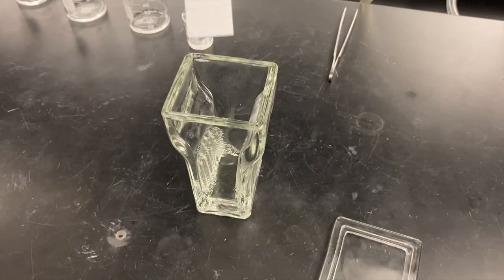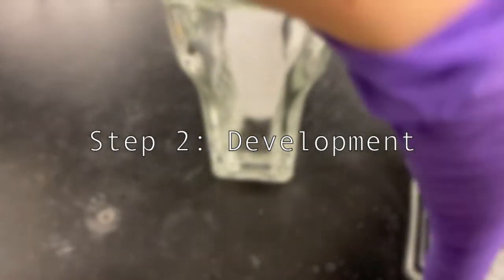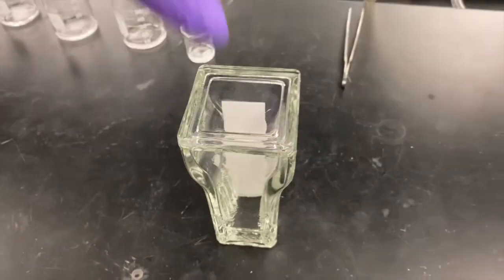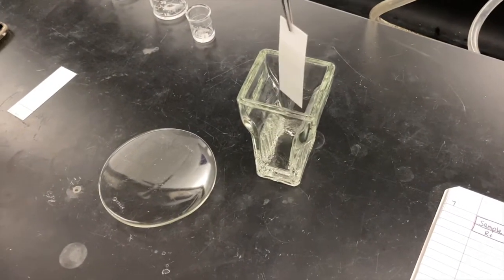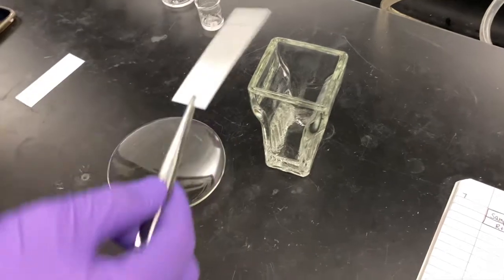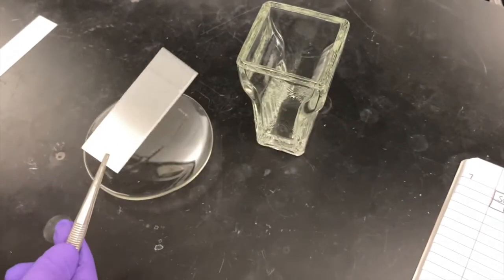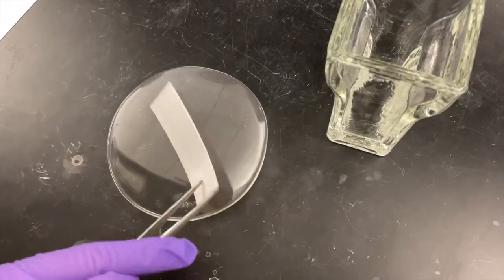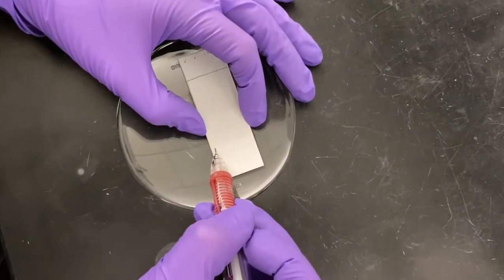The next step in thin layer chromatography is development, where you will place your plate into the chamber. Ensure that your plate is not lopsided or your results may be skewed. Wait until your mobile phase has ascended up most of the TLC plate, ensuring that it does not exceed the bounds of the plate. Once your mobile phase has reached its peak, remove the TLC plate using forceps and sketch a line where your mobile phase ends.